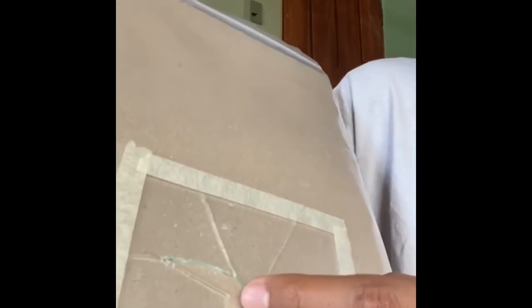Sorry, the glass is kind of cracking. The third crack that I had was right here, where the big chunk of glass is missing. When I cracked this one, it was harder because the glass looked like it was going to break, so I had to be careful with this one. It extended out here and it extended out here also. It came back here, but the glass right here kind of broke, so I can't really show you how it extended back to the first crack. But the first crack from this one kind of touched this part where the third crack was.